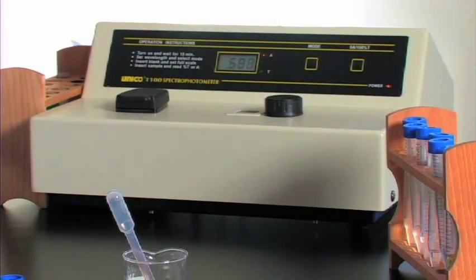Our first reading we're down to five. Look at how fast the spectrophotometer is losing absorption. This is how fast the iodine is being used up in this reaction in tube number six. I think this is really a remarkable reaction for students to do because they can actually see with their own eyes how fast the reaction occurs depending solely on the concentration of the reactants.